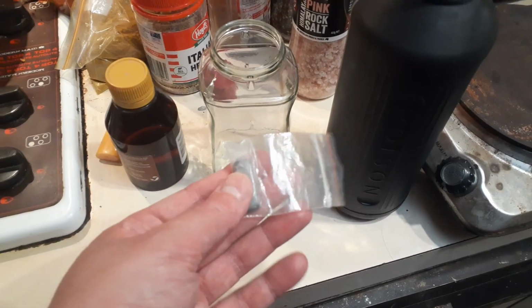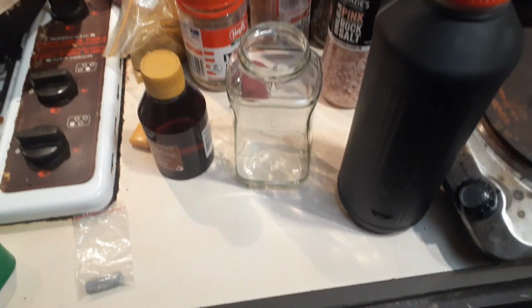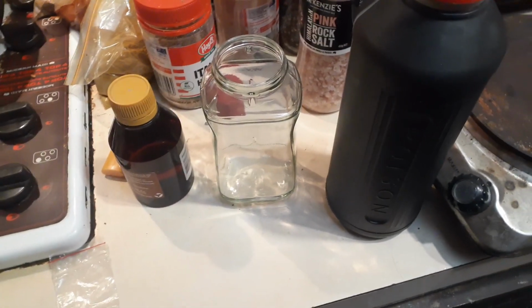You need a piece of metal. This is a piece of tin we're going to test out. So tin, you can use whatever metal you want. I've also found this can kind of work with some mineral salts like sulfates and such.